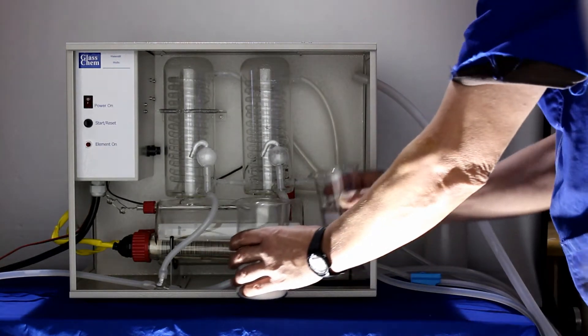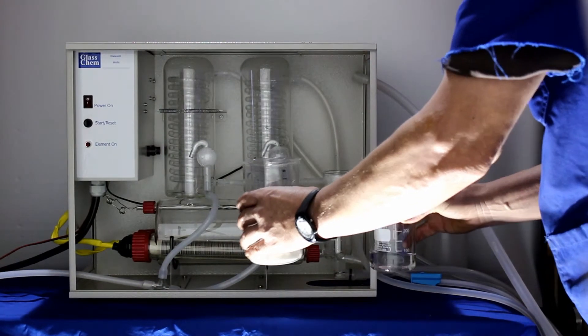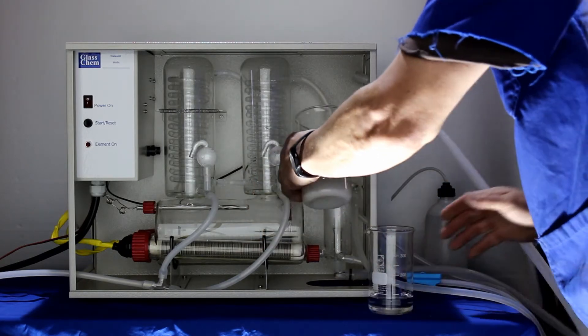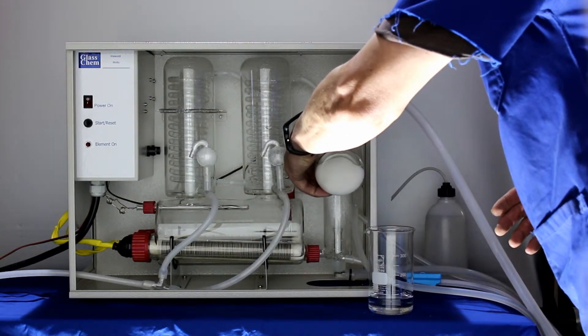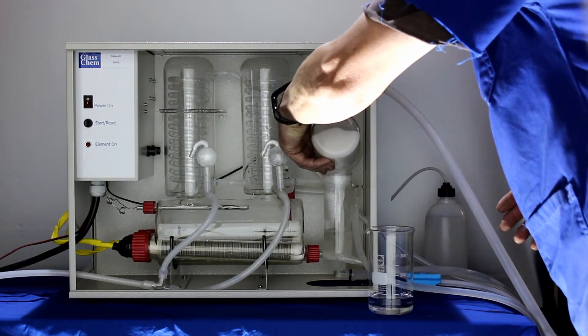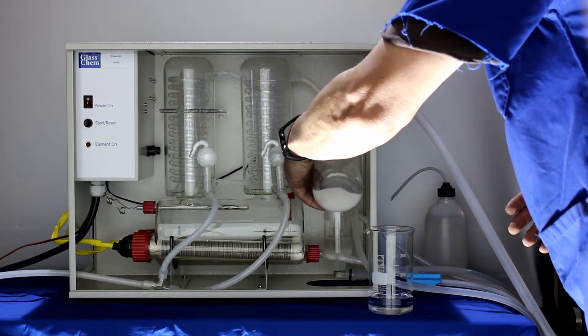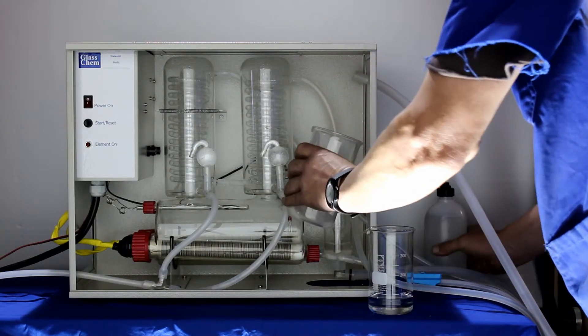Use any weak organic acid added by the constant level device to the boiler. I am using sulfamic acid but any other weak organic acid will work. Always add acid to the water, but in the case of sulfamic acid, water can be added to the crystals. Try to get all the mixed acid into the boiler.